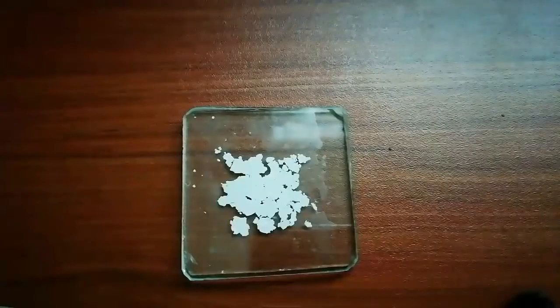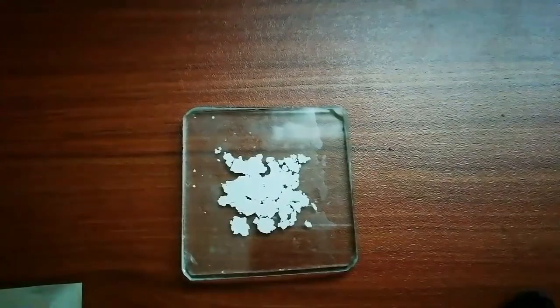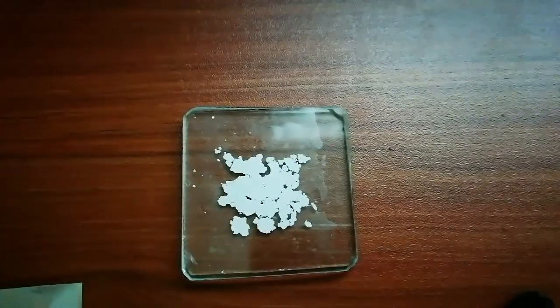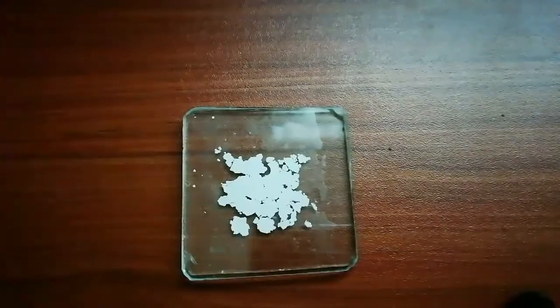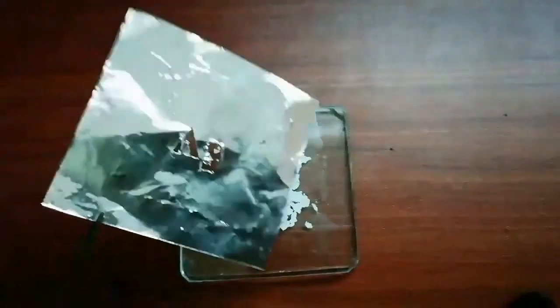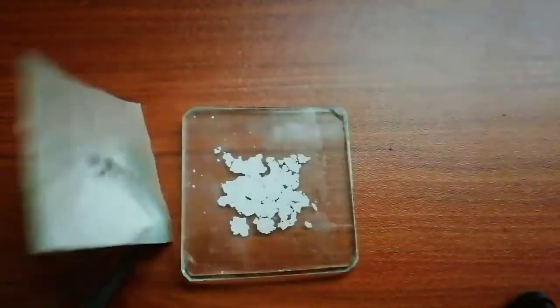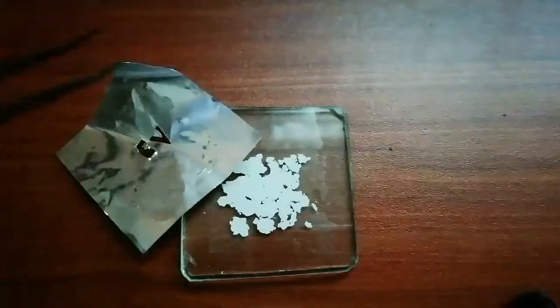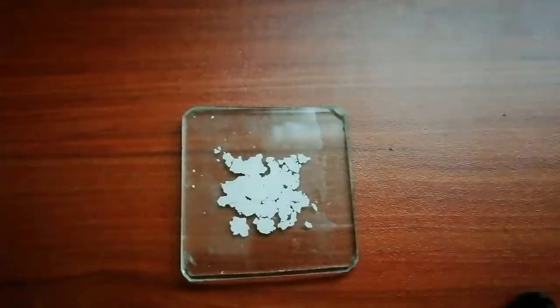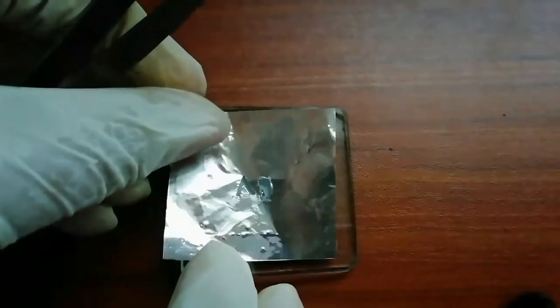Now we have the silver chloride layer. This silver chloride layer acts as a negative of a film. I have a stencil with letters A and G, and now I place this stencil on top.